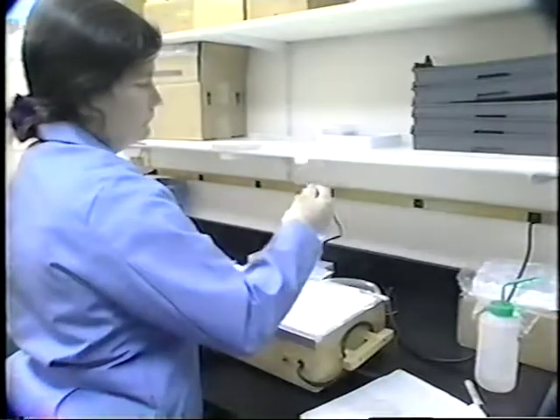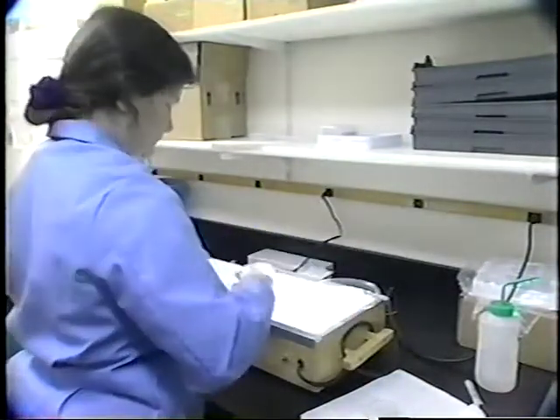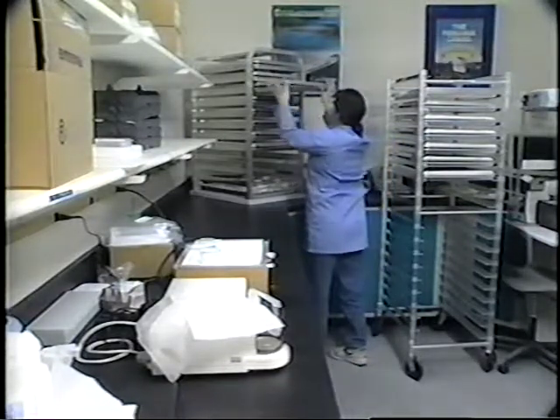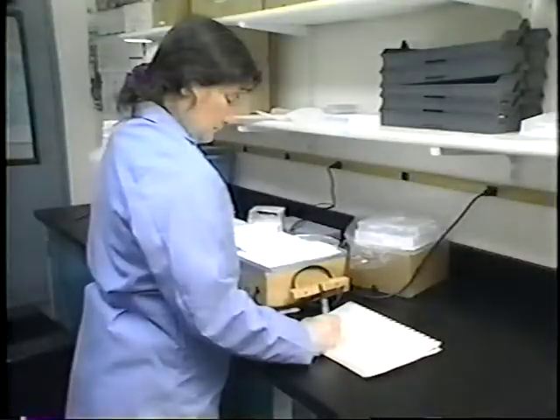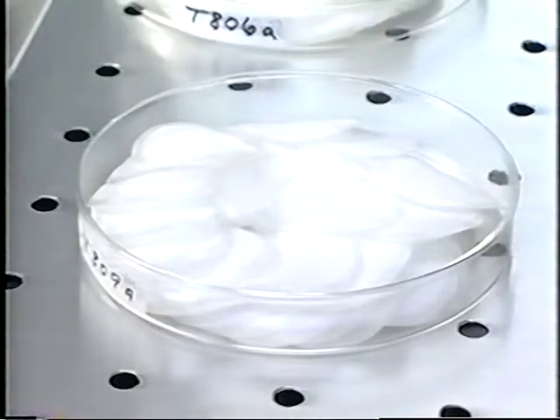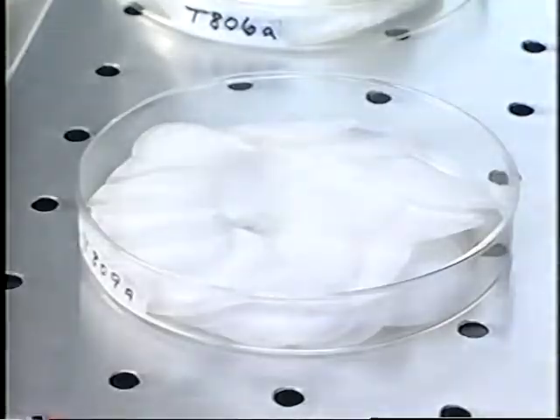Pre-treatment, use of lab and field blanks, and careful handling are only some of the procedures involved in filter handling and preparation. Along with other quality assurance techniques, they help to ensure that speciation analyses will be as accurate and valid as possible.